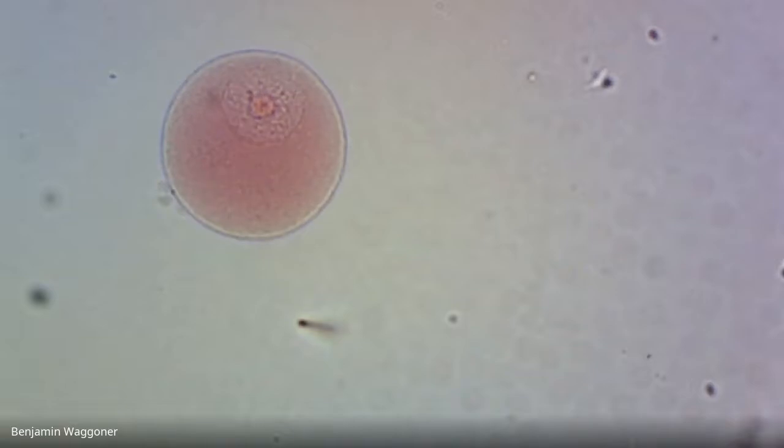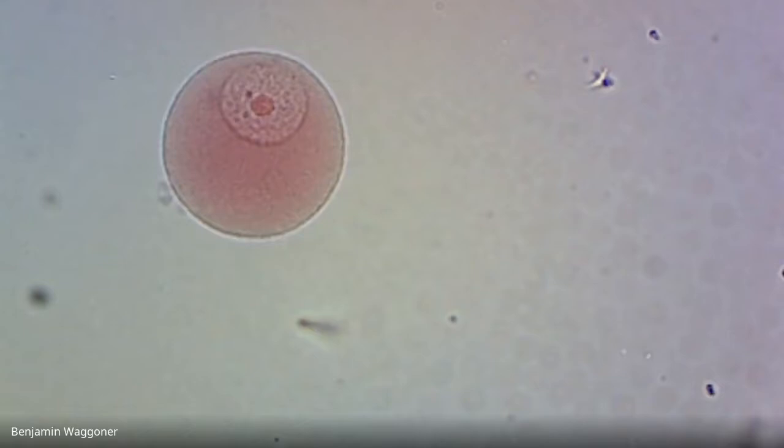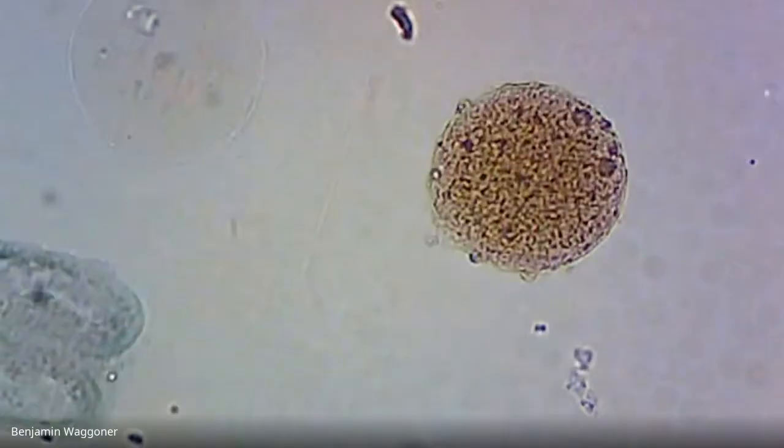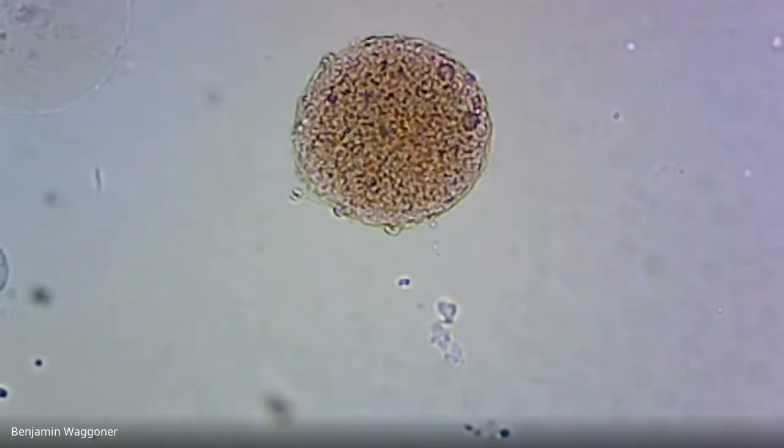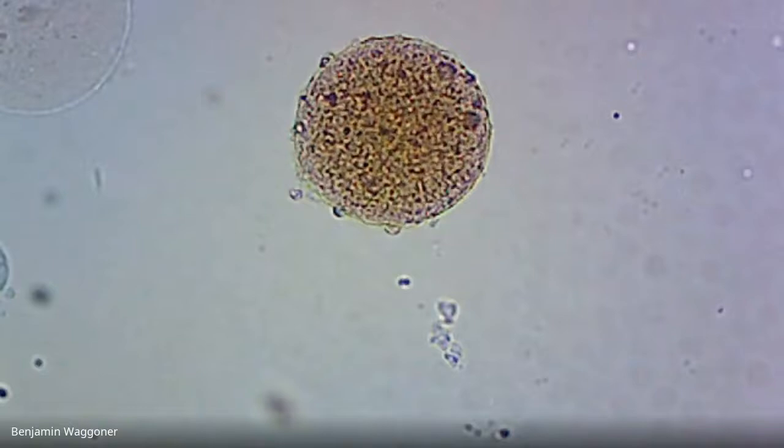And you're looking at a single egg. I mean, you can see the big nucleus in the middle. And again, that's an egg that's not quite mature, and it's also not been fertilized. When they look mature, they tend to look more like this. So that's a mature egg. A lot of the graininess in there is yolk. And we'll see the fertilization reaction happening live in a little bit.